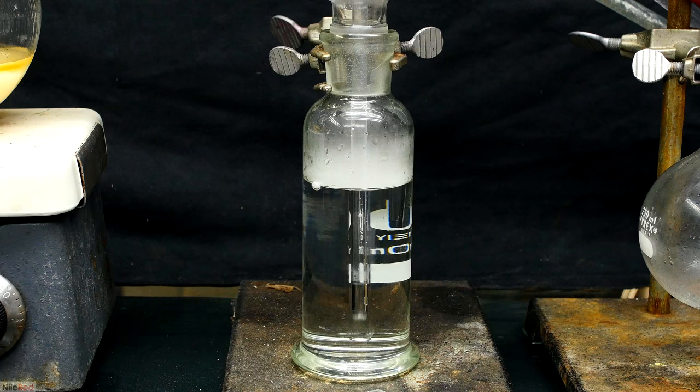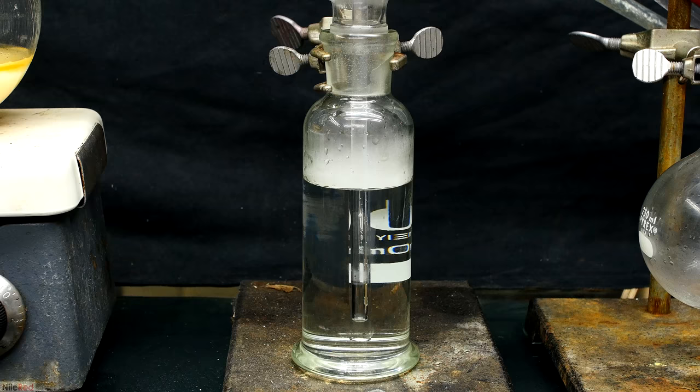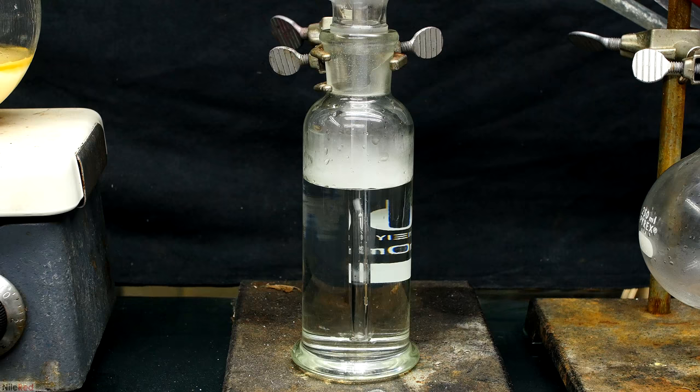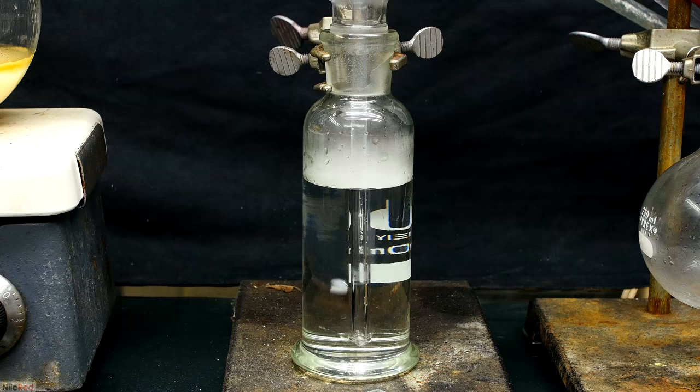Here's a close-up of the gas bubbler, and I just want to point out a few things. As the gas is passed through the hydrochloric acid, some of it does react and dissolve, but clearly some of it still makes it to the top. When it reaches the top, the gas is released to the upper portion of the bubbler, but you can see that it quickly reacts and falls back down.